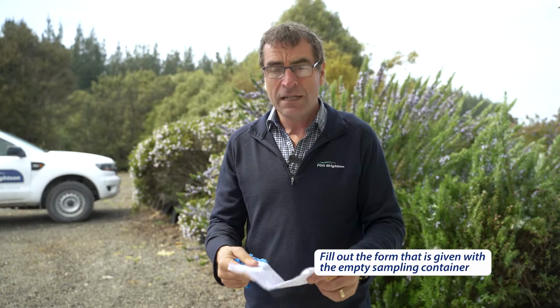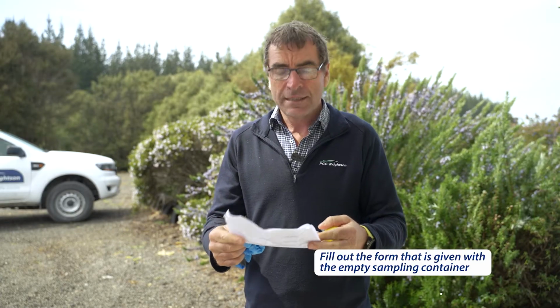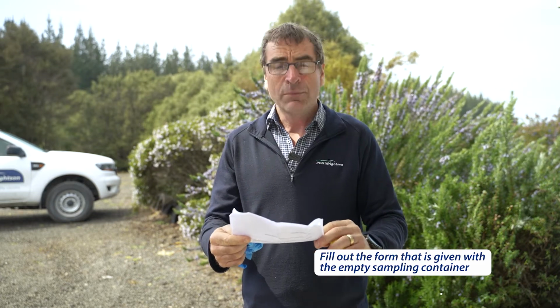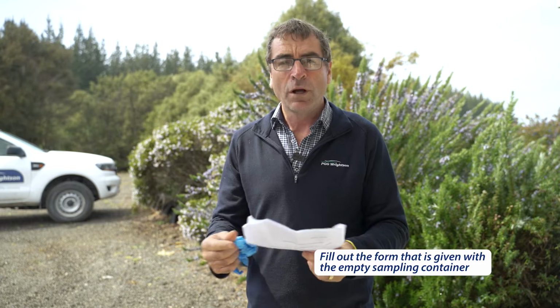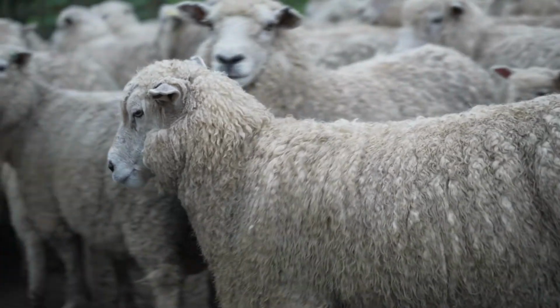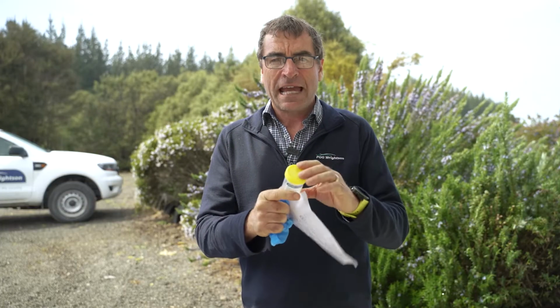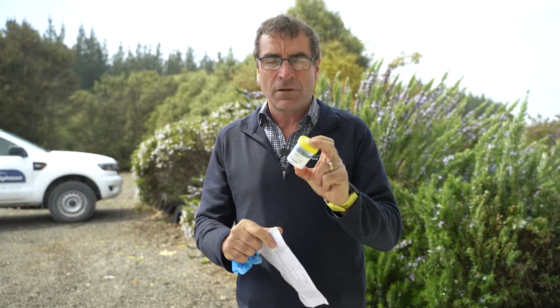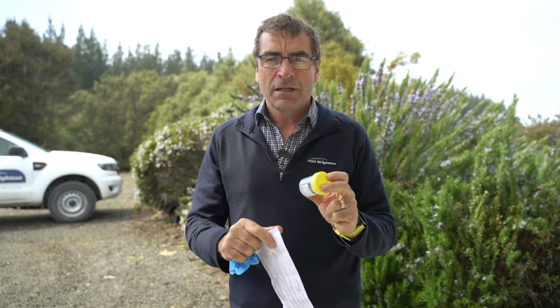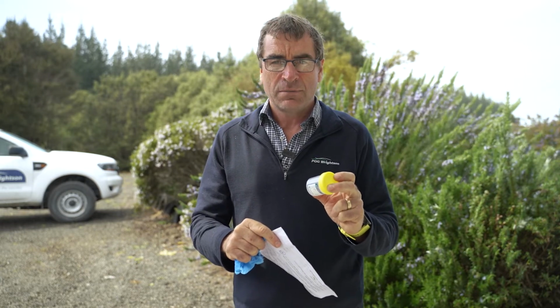It's very important then we fill out the form. I need to know which farm the samples are from, what animal, is it sheep or cattle, and what you're trying to look for. So the two ways that we use a faecal egg count is these go to the lab, they then count the number of eggs in the 2 grams of faeces. This can help determine the worm burden of my sheep to indicate whether or not they need a drench.